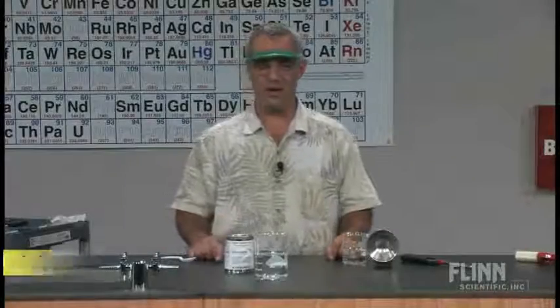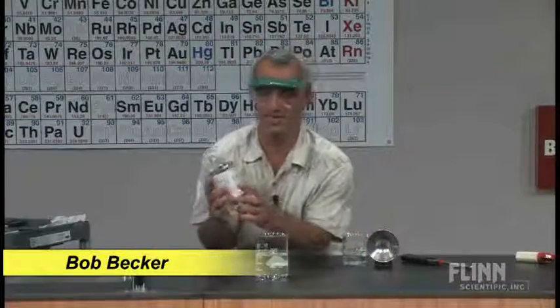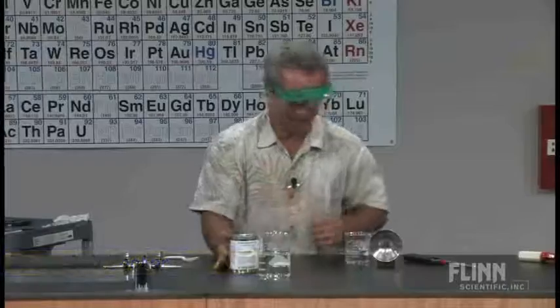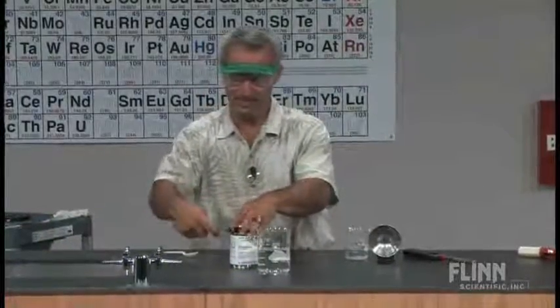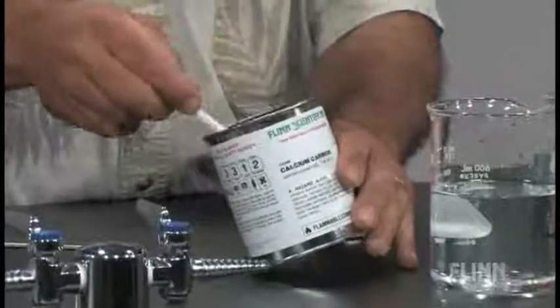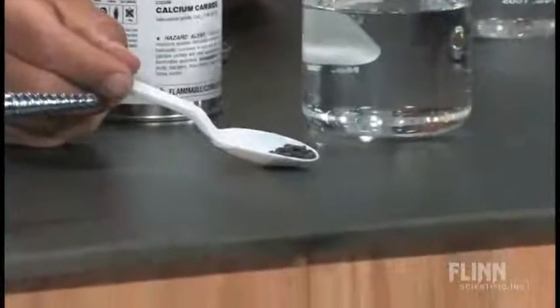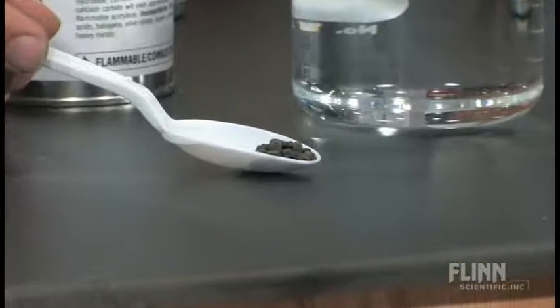I'm going to introduce you to one of my all-time favorite compounds — calcium carbide. Now if I open up this container and show you what this compound looks like, you'd say that looks a lot like gravel. But it's not.